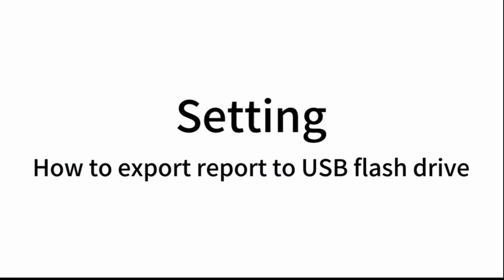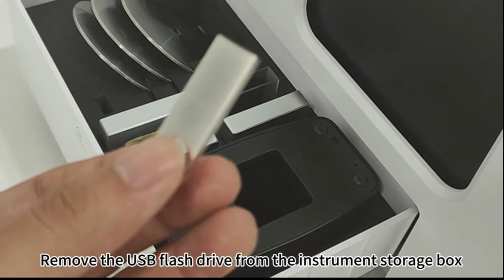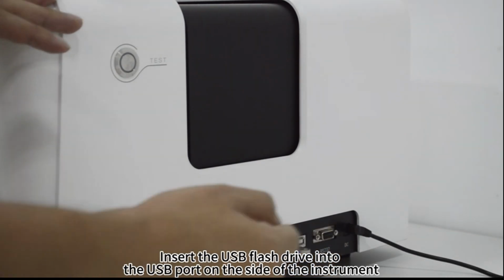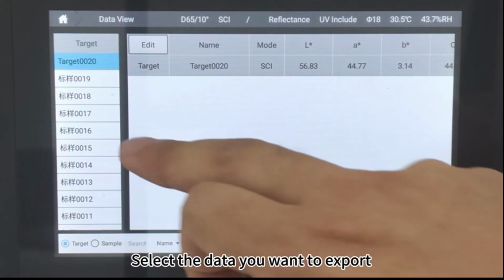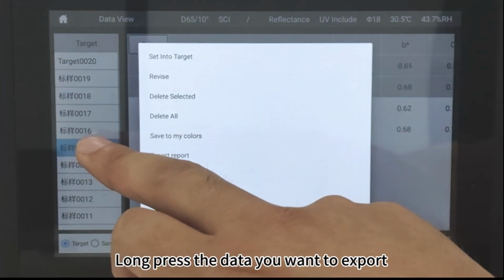Setting, how to export a report to a USB flash drive. Remove the USB flash drive from the instrument storage box. Insert the USB flash drive into the USB port on the side of the instrument. Click Data View. Select the data you want to export. Long press the data you want to export.